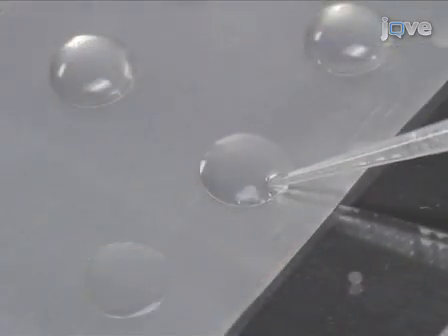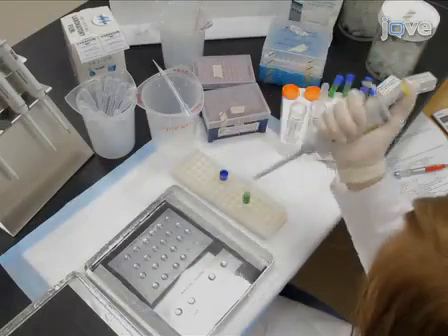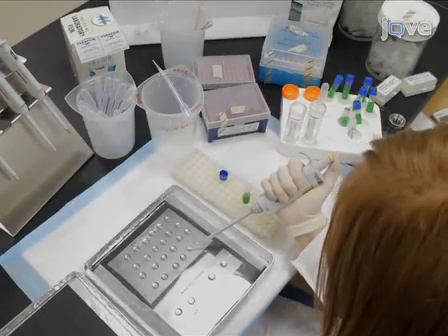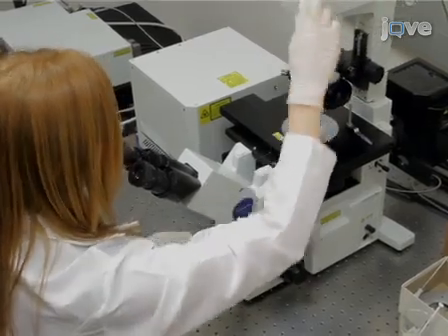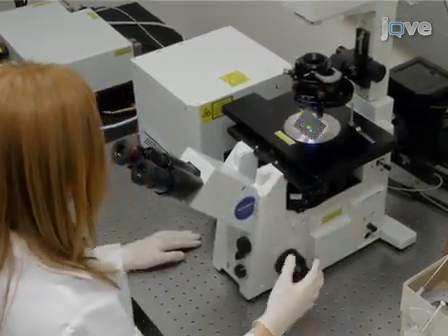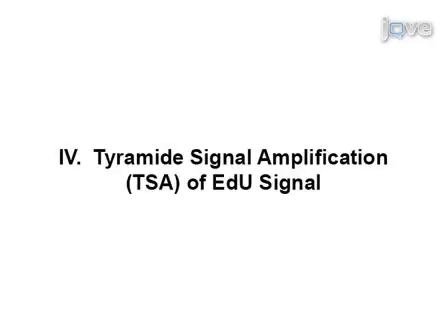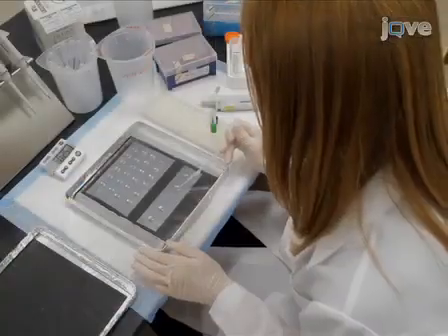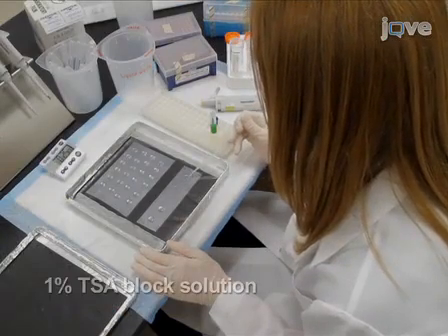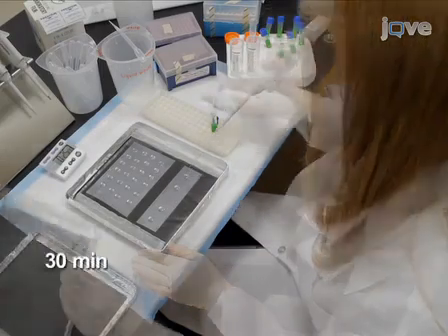Gently remove the reaction cocktail. Wash twice with diluted 1x blocking buffer. Under an epifluorescent microscope, check for Oregon green staining in nuclei. When the EDU staining is complete, begin the tyramide signal amplification, or TSA. Add 1% TSA block solution to each cover slip and incubate at room temperature for 30 minutes.